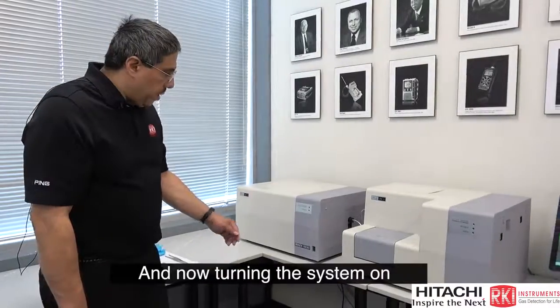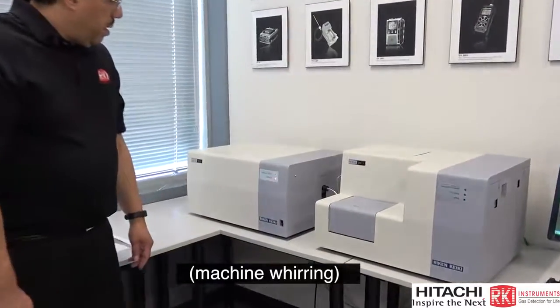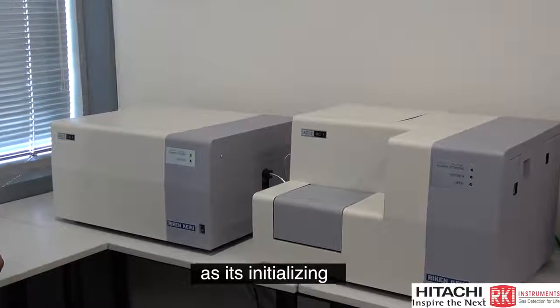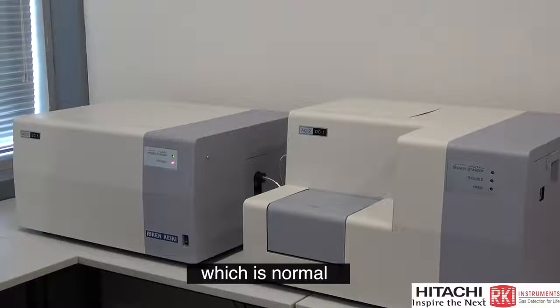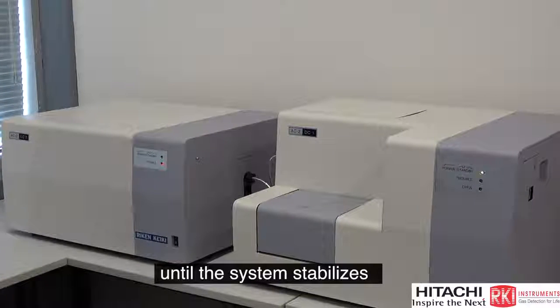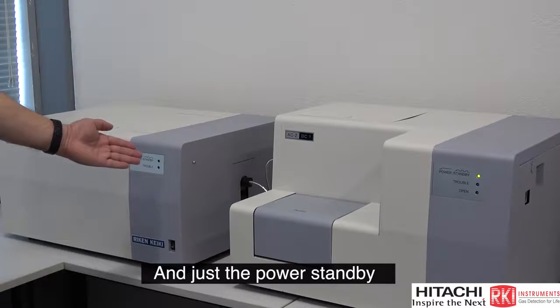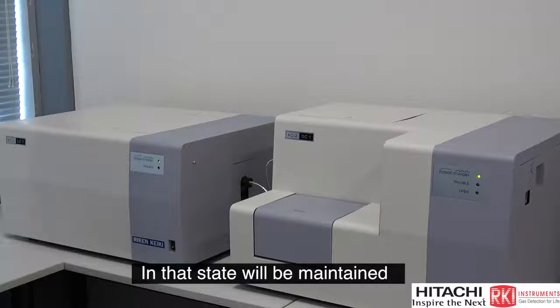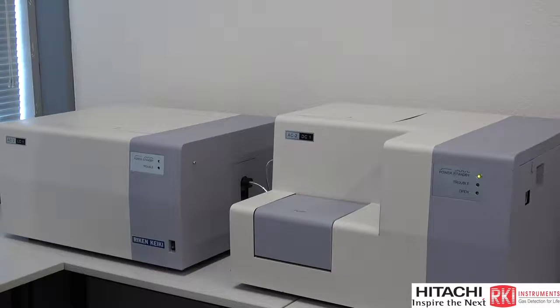And now turning the system on, I'll turn on the power button here. We can hear the system making some noises as it's initializing. We can see that the lights are flashing, which is normal. The trouble light will flash for several seconds until the system stabilizes. Then that light will extinguish, and just the power standby lights will be flashing green. And that state will be maintained for about 30 minutes. We have to let the system warm up for about half an hour before we can proceed.